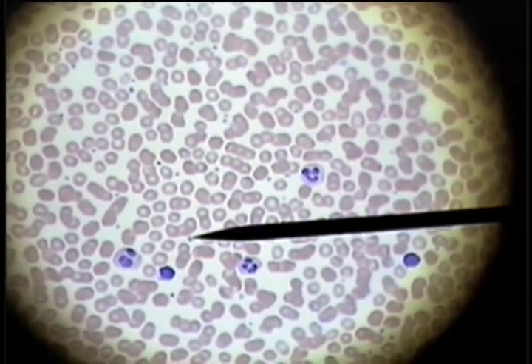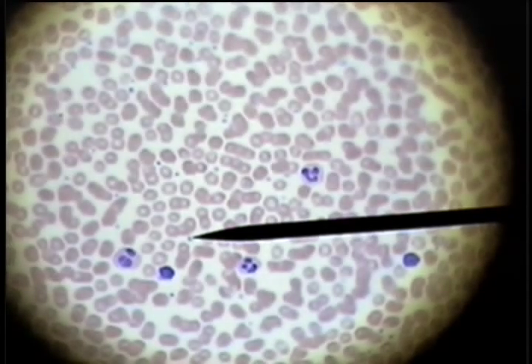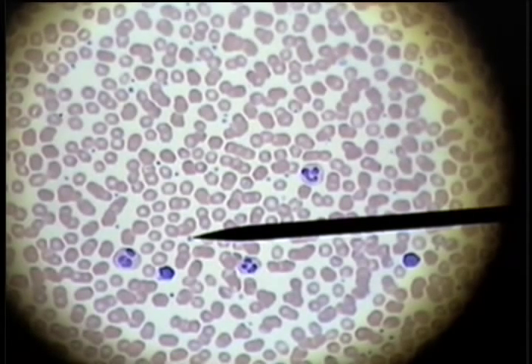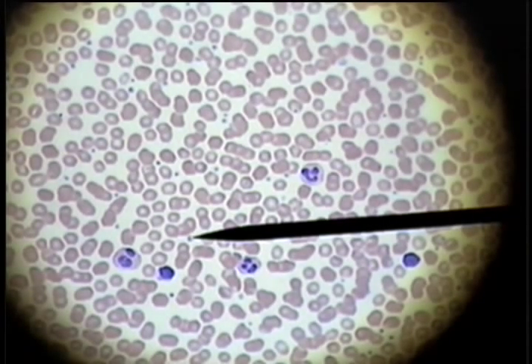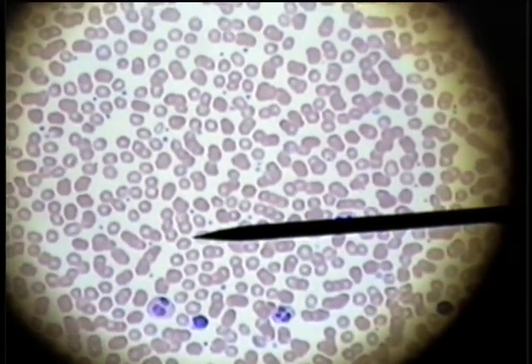The next most common structure found is this formed element in the blood — the platelet, which is associated with clotting. These small black dots are platelets.